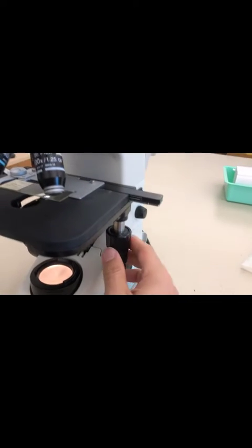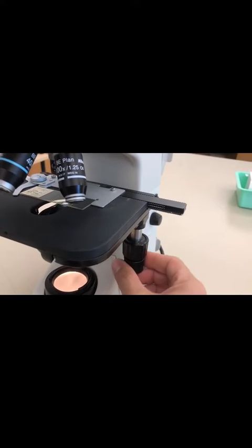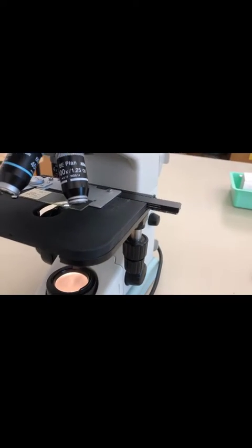Remember how to do that? You've got these two dials that move the sample around. Make sure the sample that you're looking at on lower power is right in the middle.